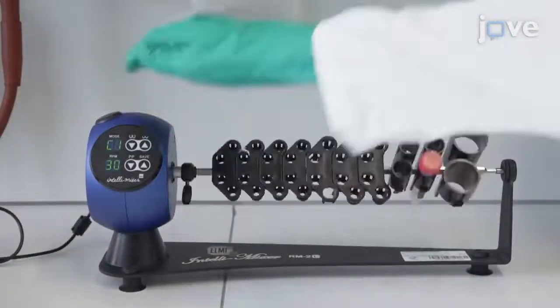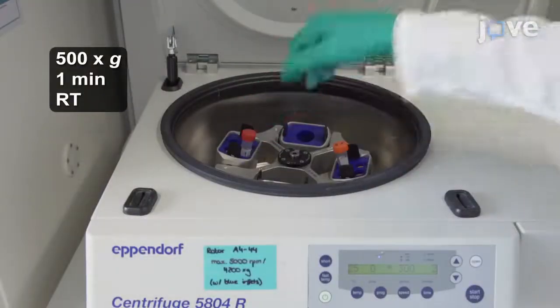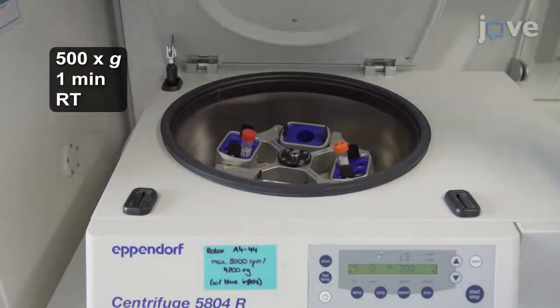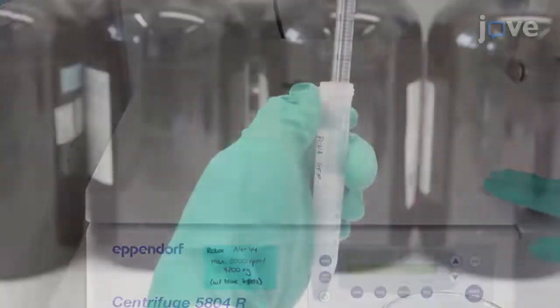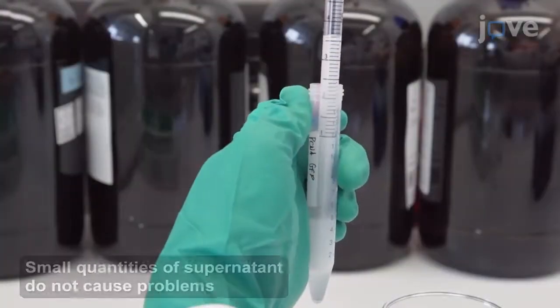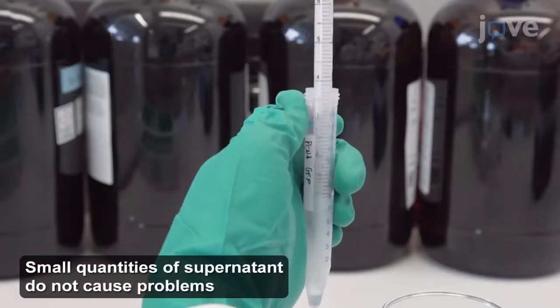Agitate the mixture on a rotary mixer for 10 minutes. Centrifuge the tube at 500 times G for 1 minute at room temperature to collect embryos at the bottom of the tube. Aspirate the entire shampoo-like liquid and discard it, taking care not to aspirate any embryos.